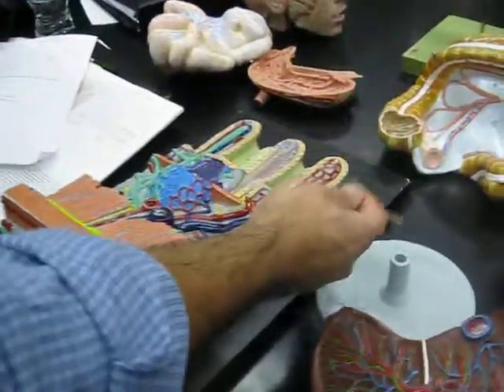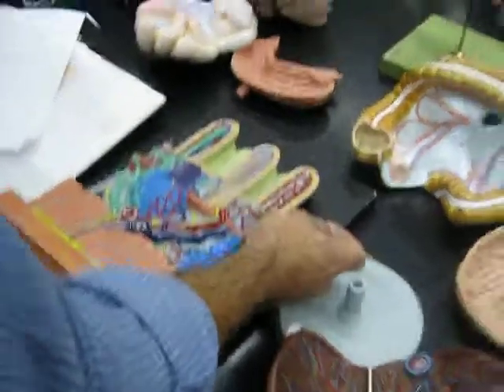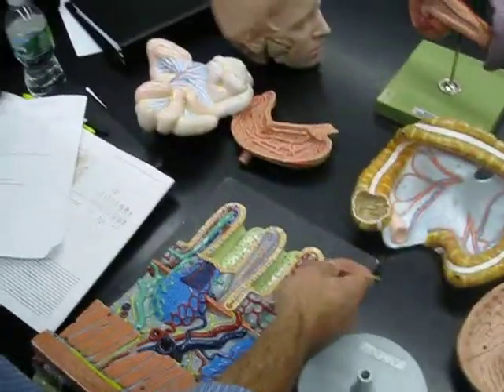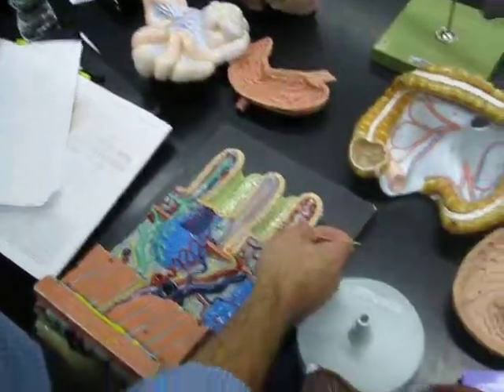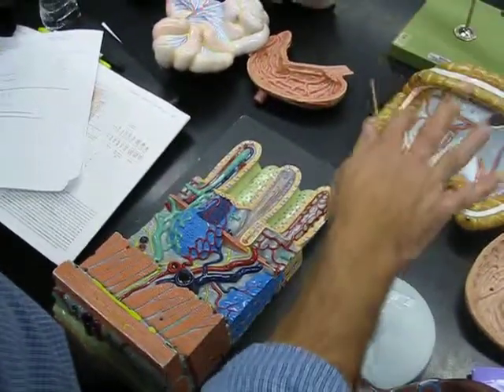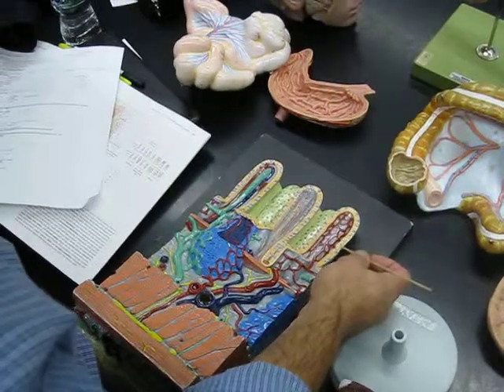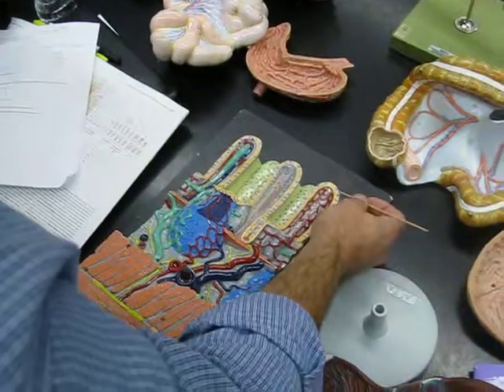Attached to the mucosa are these columnar epithelium, and you can see the blue nucleuses in some of them. All the nucleuses are on different planes, so you don't see all of them.